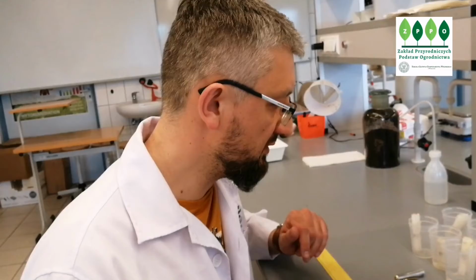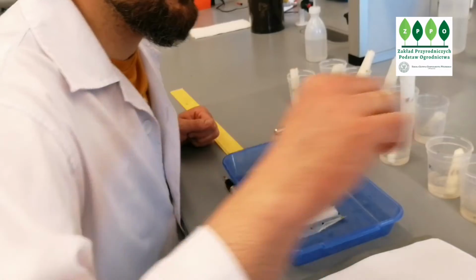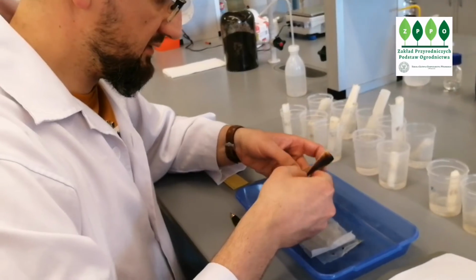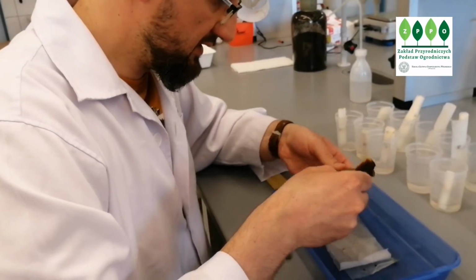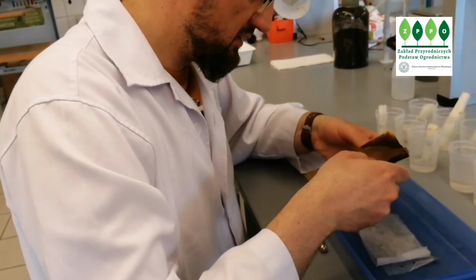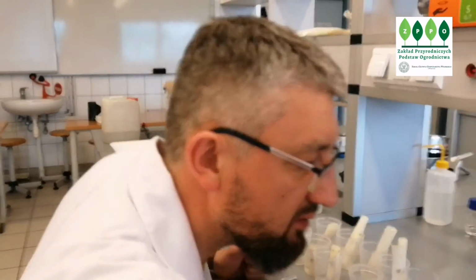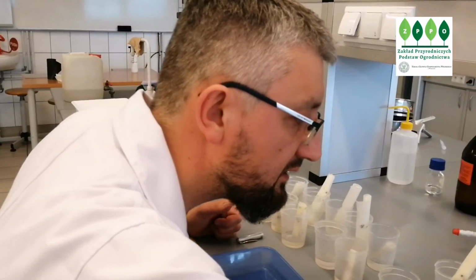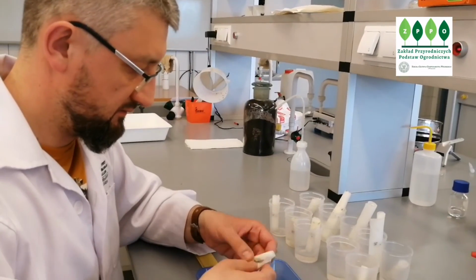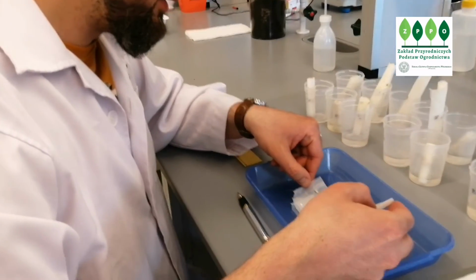And I think there is no need, but maybe I will open one more just to show you how it looks. I will take the highest concentration of allelochemical just to see the negative effect. That's maybe not the best idea, because I will get dirty. So maybe we will take one of those. Not that bad, as we can expect.